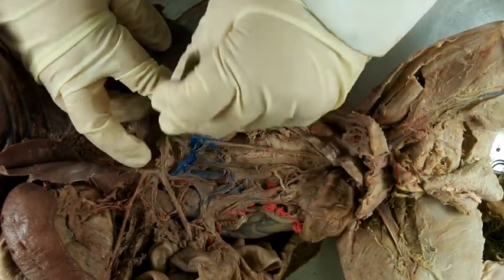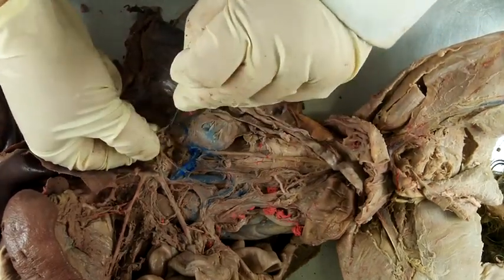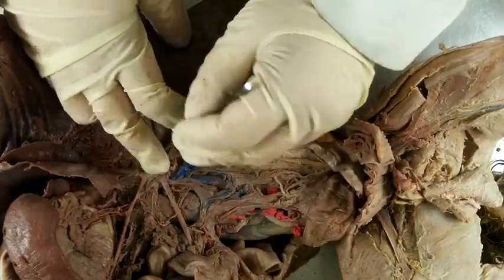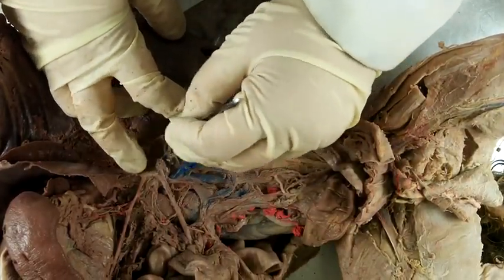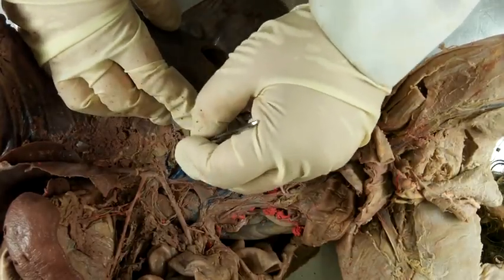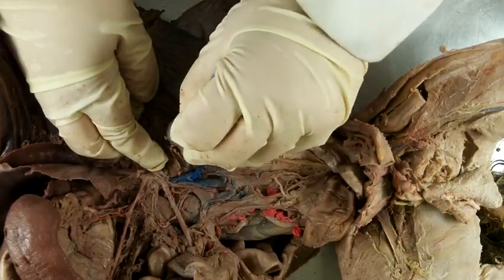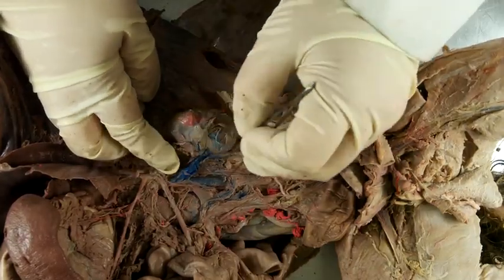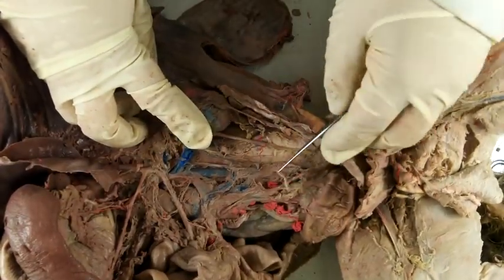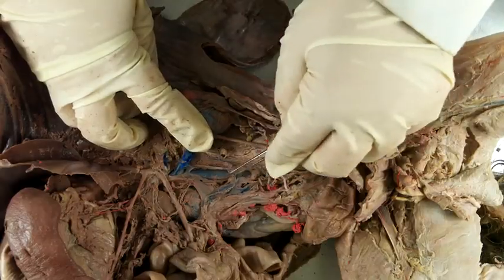It looks like there's been a burst in this kidney. The anterior portion of the kidney, this looks like fat. This is actually the adrenal gland. And any arteries and veins going into that region are the adrenal arteries and veins. You have your renal vein, very large and obvious, dorsal to that abdominal aorta. We can continue following the abdominal aorta using our guides that we've established earlier.